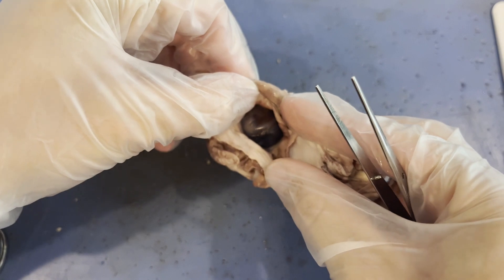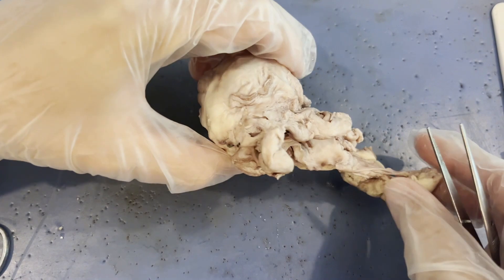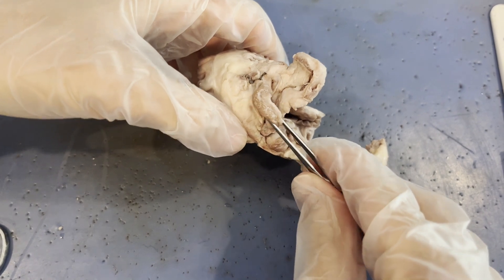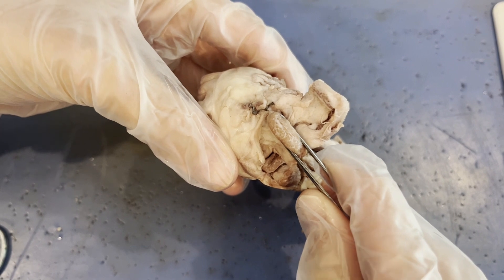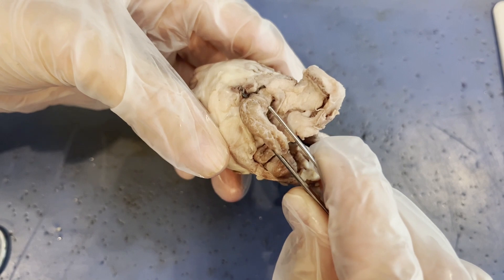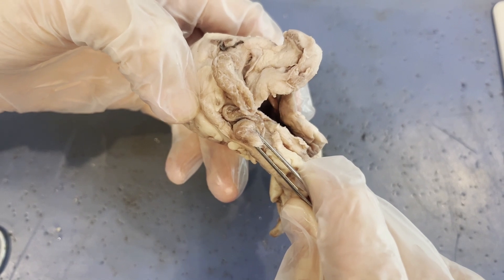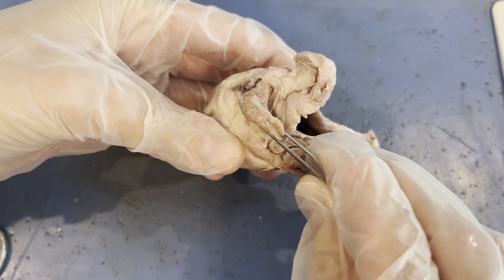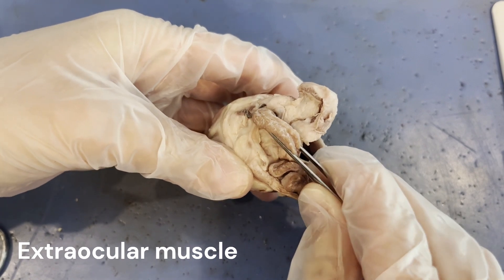I can see the cornea of the eye right there. But before we start looking at the eyeball itself, let's talk about all of this excess tissue. There are two main types of tissue found on the outside of the cow's eye. The first type kind of looks like a marbled steak — because steak is the muscle of the cow, and this is a muscle of the cow as well. This is a skeletal muscle, which means the cow had control over when it contracted and relaxed. This specific skeletal muscle is known as the extraocular muscles, which really just means muscles on the outside of the eye.